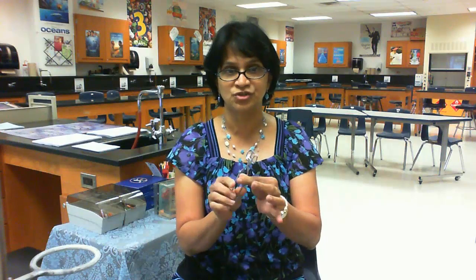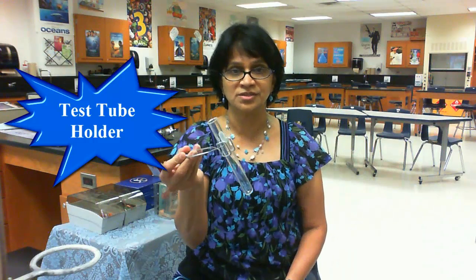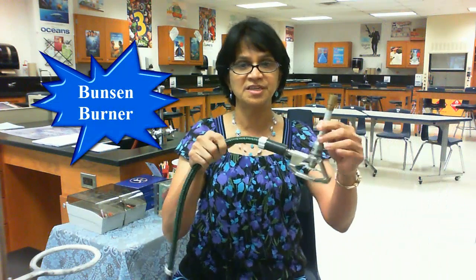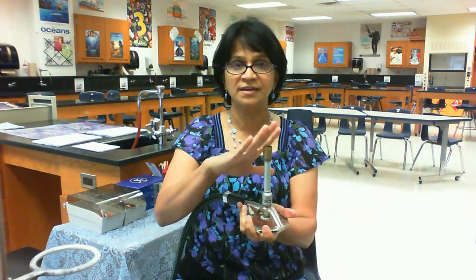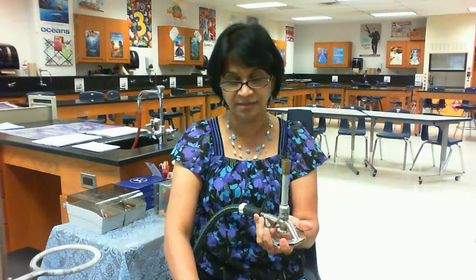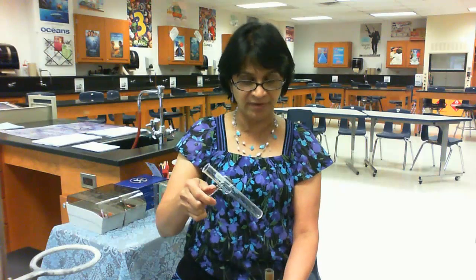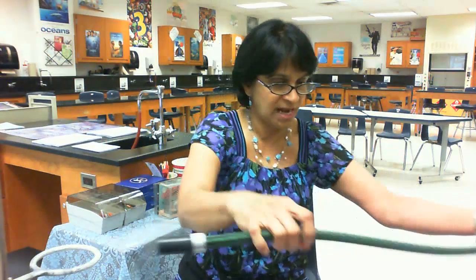If the test tube is hot, we are going to use something called the test tube holder — and that is the way you are going to use it. I also forgot to mention the Bunsen burner. We get methane gas through the inlet, and it is used for getting the right flame. We can use a test tube for a reaction without holding it in the hand, and if the test tube is hot, we use the test tube holder to grab it.